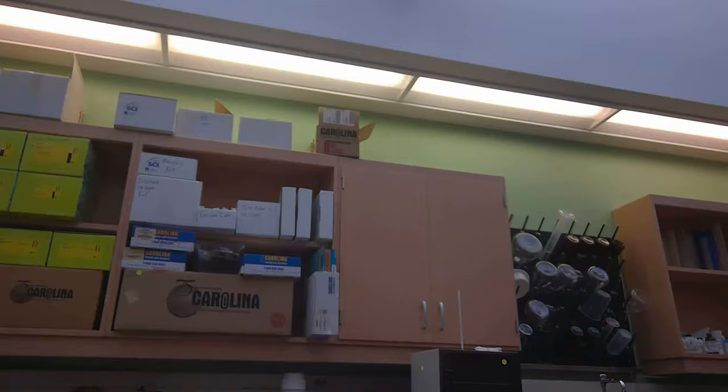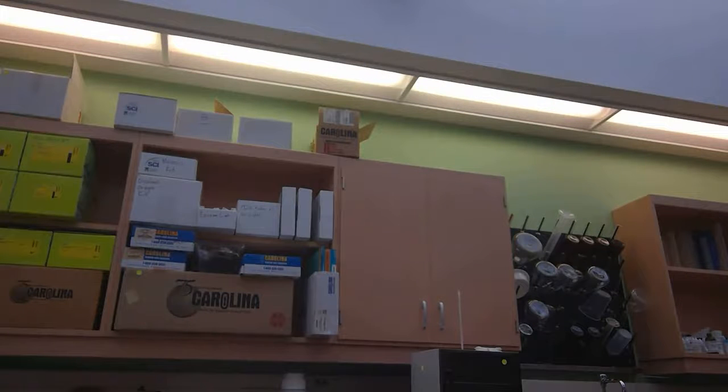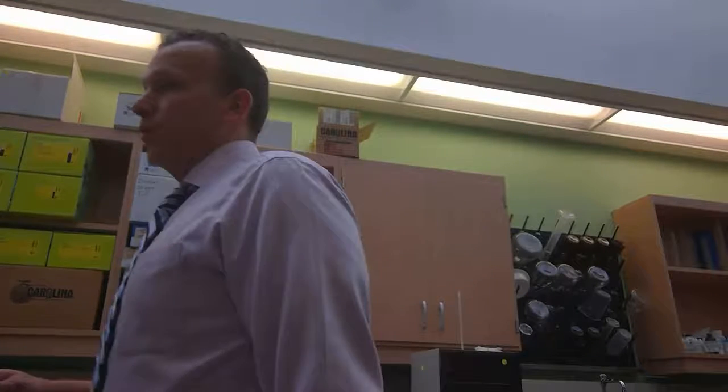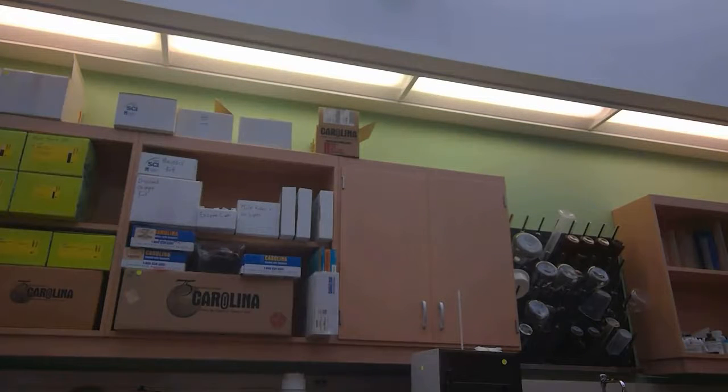Throughout the room, there's a bunch of different carb types to sample. There's some more over here too. So I'm going to teach you a lab technique that you can use to determine the type of carbohydrate in each unknown sample. Okay? You can see from your sheet, we're going to be using what tests? The Benedict test and iodine. So let's walk through this protocol together and think about a logical way to go through this experiment.